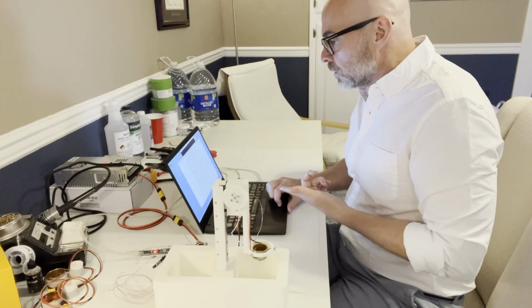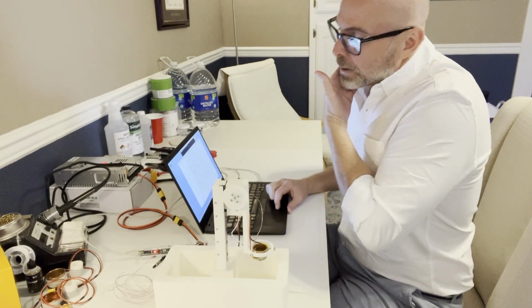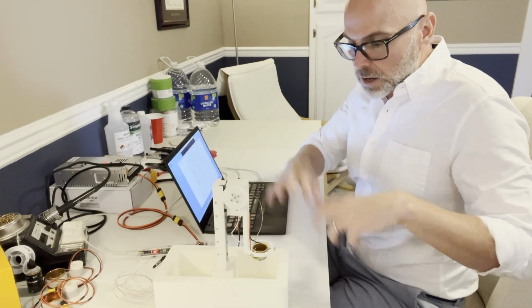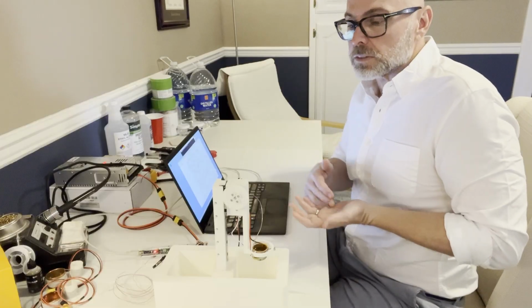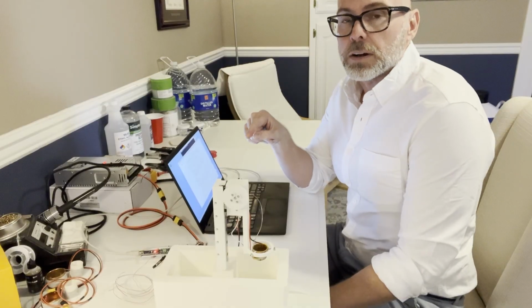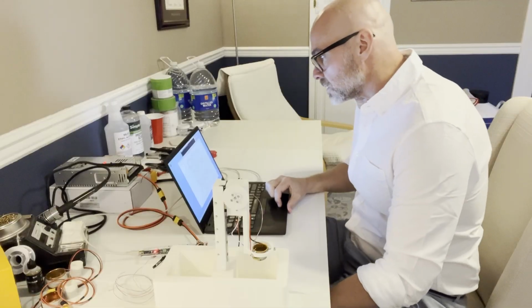So here on the computer, this is data. What I did first was just record a ton of runs of random controls and log the temperature, so the temperature response to the controls, so the heat and the power. I then trained a model to predict temperature from the control input. And that's what this is.